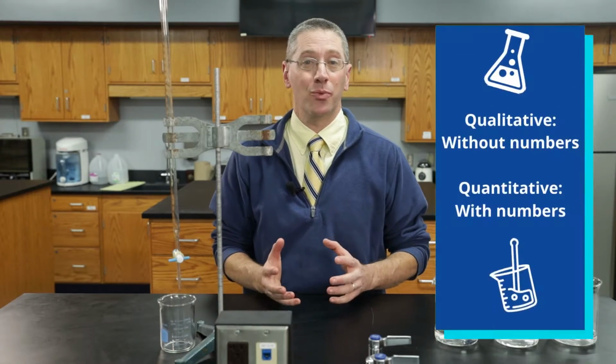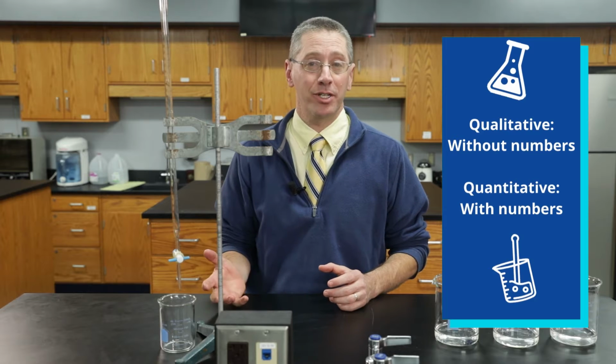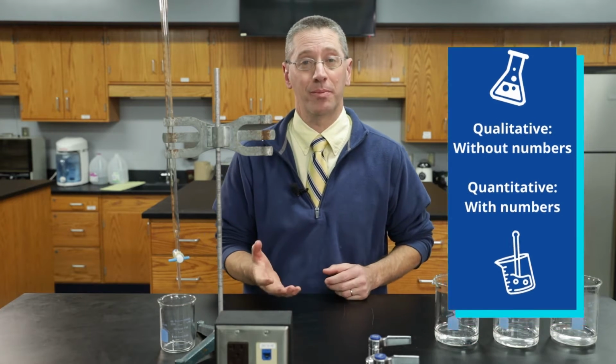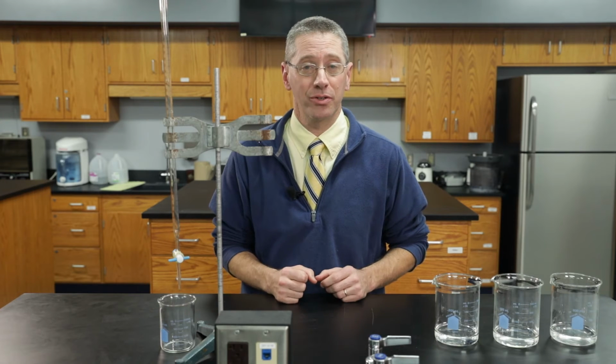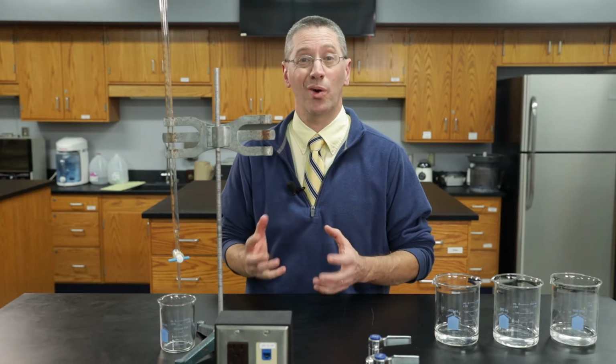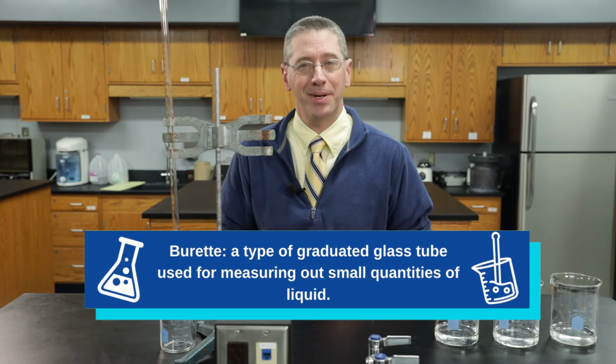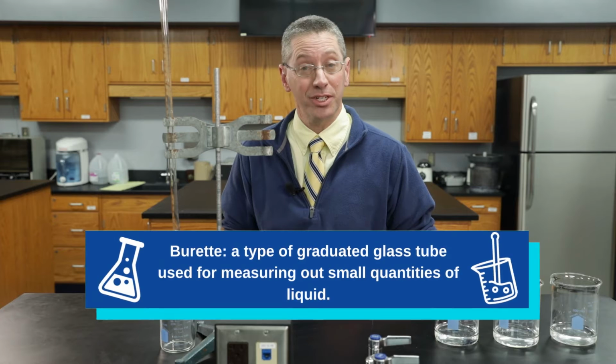Qualitative experiments are done without numbers, and quantitative experiments are done with numbers. The previous demonstration was a qualitative experiment looking at the concentration of solutions. And if you want to scale that up to a quantitative lab, you need one of these. It's called a burette, and it's basically a fancy graduated cylinder that's upside down.